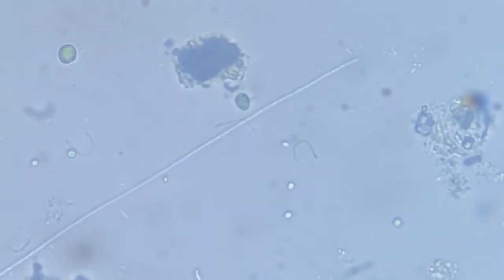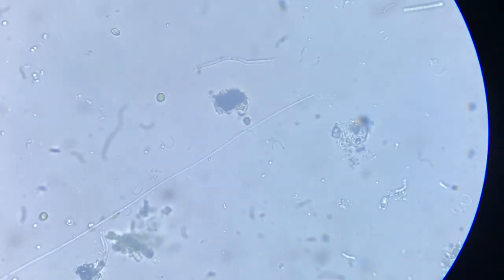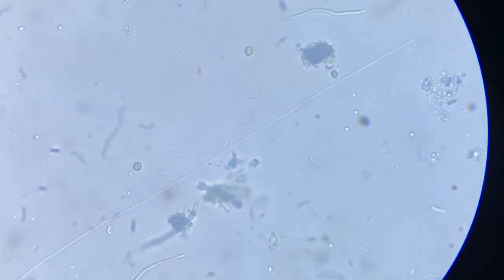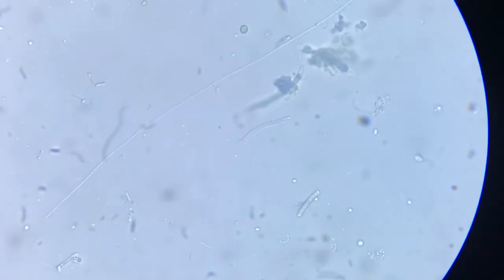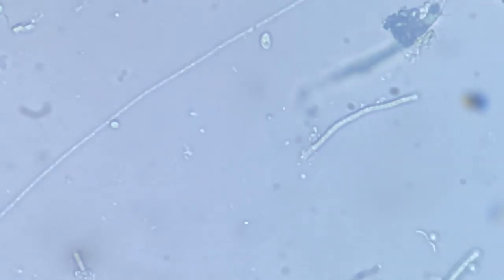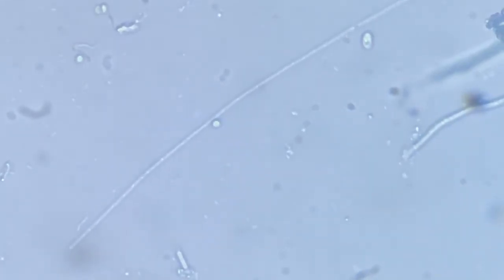And the reason why it is moving slow comparatively, when I've observed it move, it moves very fast. You can make an idea how long it is. Just look at this length. Straight like a highway. So it's obvious that it is very difficult for it to move. Look at this. This is crazy stuff. There are bacteria in the background, which you can see, and it's just around as thick as a bacteria.